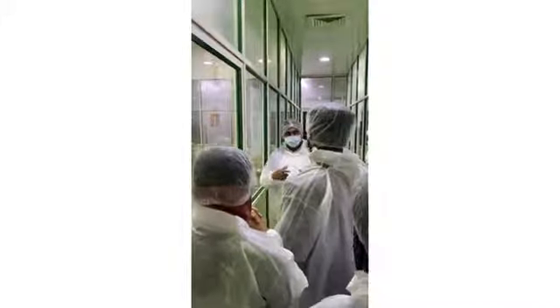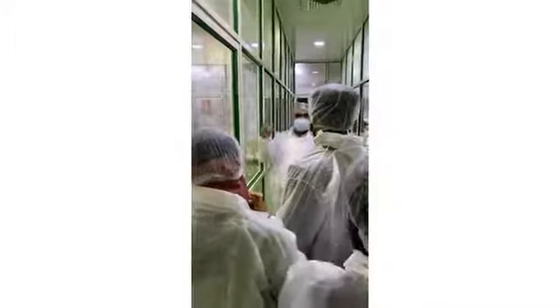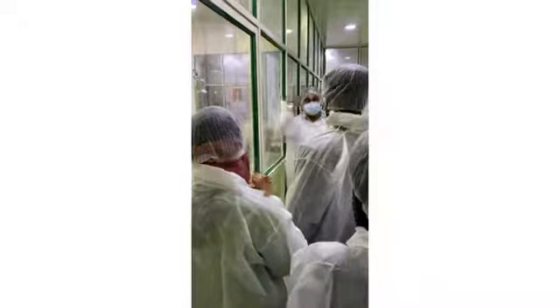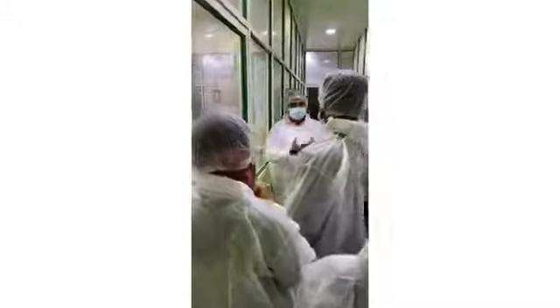Once we have clearance, we dispense the raw material to production. Then here we do formulation and batch manufacturing. The production department does documentation, and after that they do batch manufacturing. Then it is sent to the stores, to the godown. Then it goes to sales. So this is a series of steps.